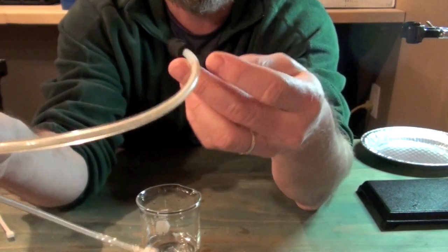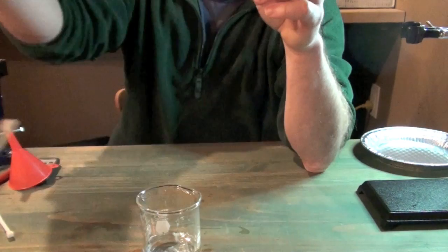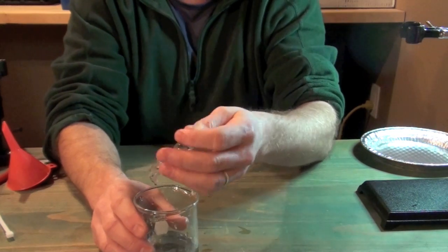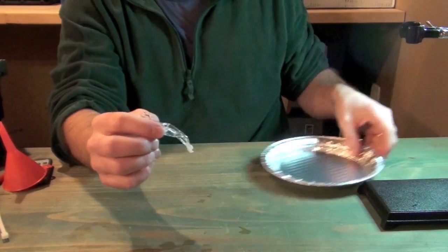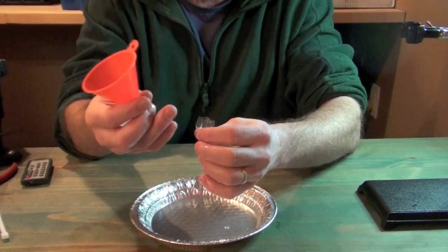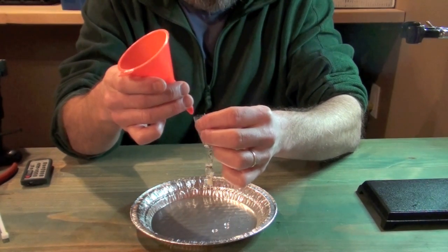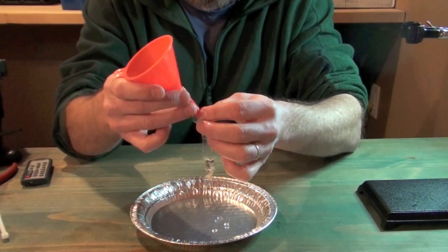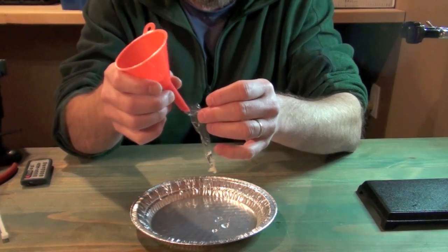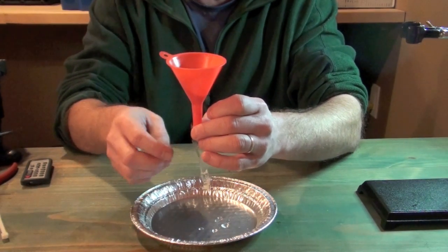So what we're going to do is we're going to take this and we're going to insert it into the end of our dialysis tubing. So let's do that. We'll take our dialysis tubing and then we'll get something that we can work over so that we don't make too much of a mess. And then all we got to do is grab our handy dandy funnel and get that funnel into the end. So there's our funnel into the end of our tubing.